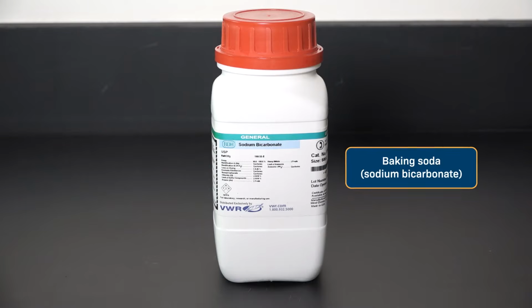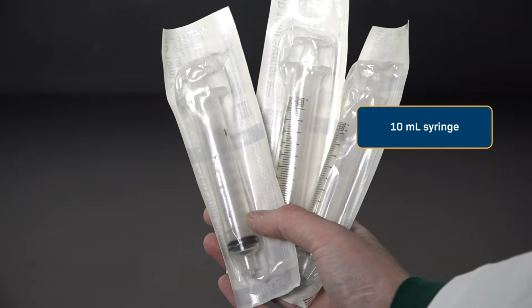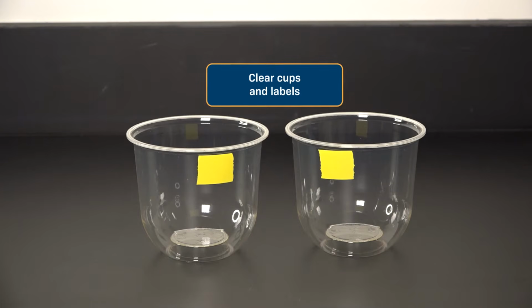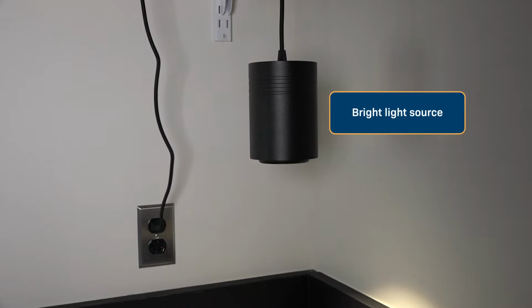Let's get started. We'll need baking soda, aka sodium bicarbonate, diluted dish soap, about 5 milliliters of soap in 250 milliliters of water, a pipette, 10 ml syringes without needles, living leaves. Today I'm using baby spinach from the grocery store, a hole punch, clear cups or beakers and a way to label them, aluminum foil, a timer, and a light source.